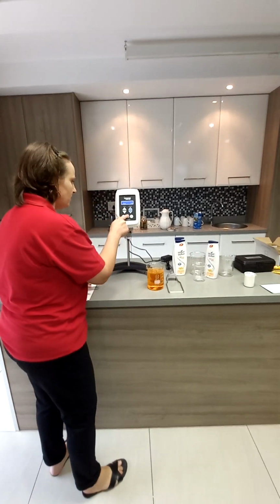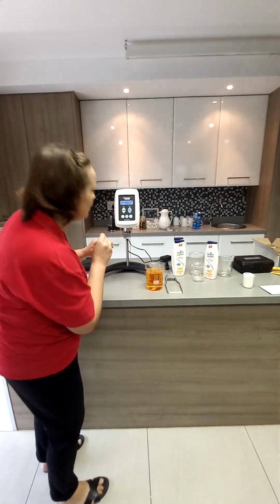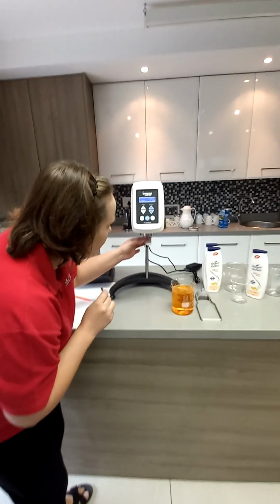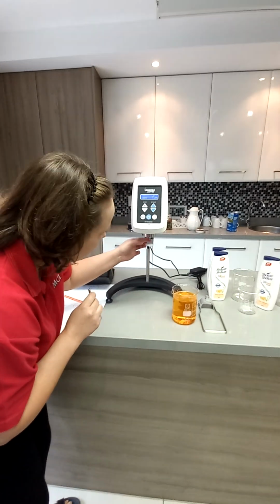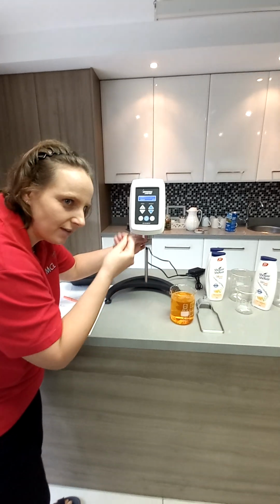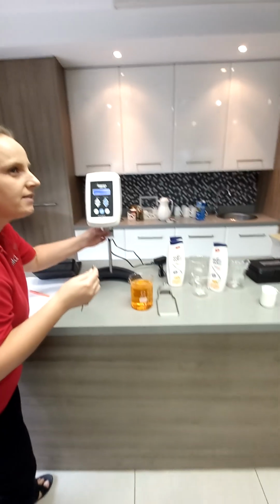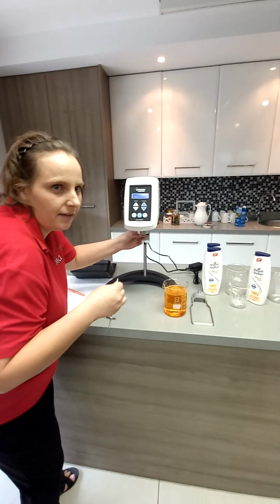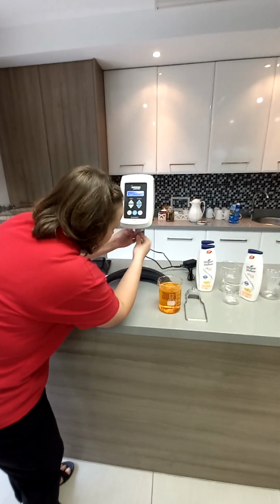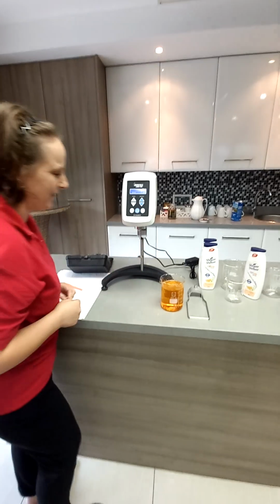So the unit is on, there's an on button here. This is a very important point to take note of: how to attach the spindle. You'll see here this coupling can lift. So you lift it and hold it in place, and with your other hand you're going to screw the spindle on. It's a left-handed thread, so it is lefty-tighty, not righty-tighty. You guys can practice when we're done. I'll get each of you to come do a test.